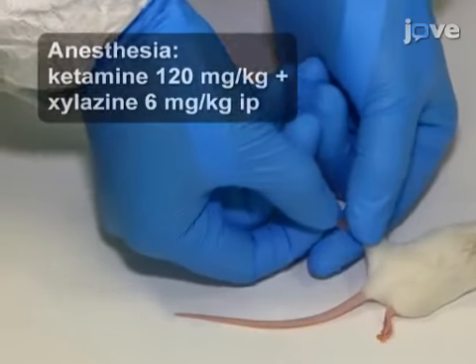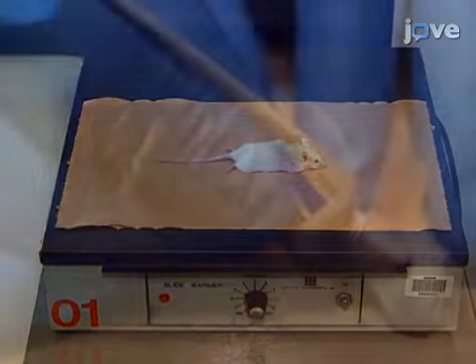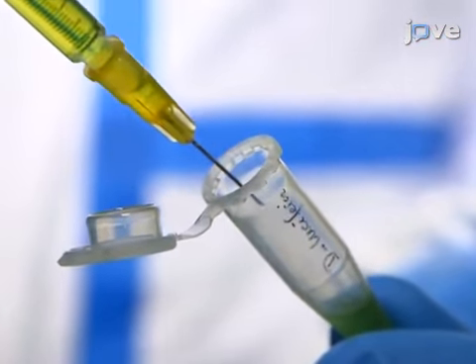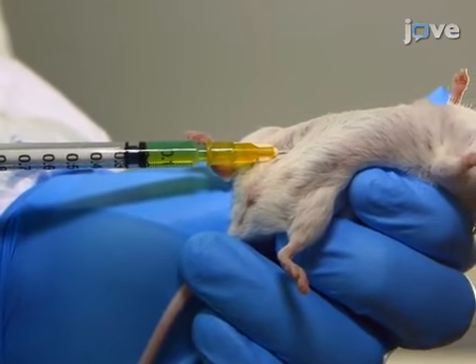After confirming the appropriate level of sedation by lack of response to leg pinch, place a mouse on a warming pad and apply eye ointment. Then, use a 25-gauge needle to inject 100 microliters of freshly prepared D-luciferin potassium salt solution intraperitoneally.